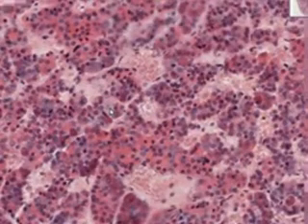And we'll find some more. Here's one. Here's one. Sometimes there's a good number of them, and sometimes you have to look hard. These are the chromophobes. They don't secrete anything. So here's the acidophils. Here's some basophils. And here's really, really a nice chromophobe here.